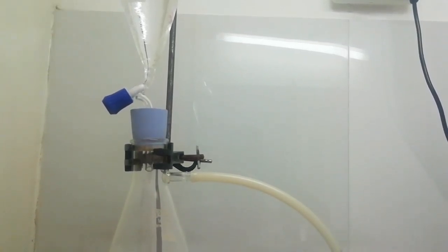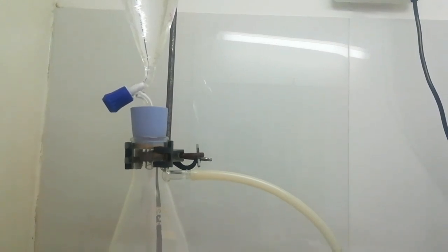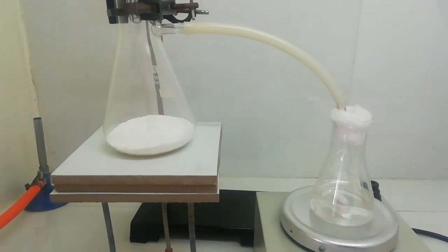Now I am going to mix these together. In this reaction we can make sulfur dioxide gas. In this conical flask I have the solution we prepared already. Now I am going to bubble sulfur dioxide gas through it. I have covered the top of the flask using cotton wool. So let's start the reaction.